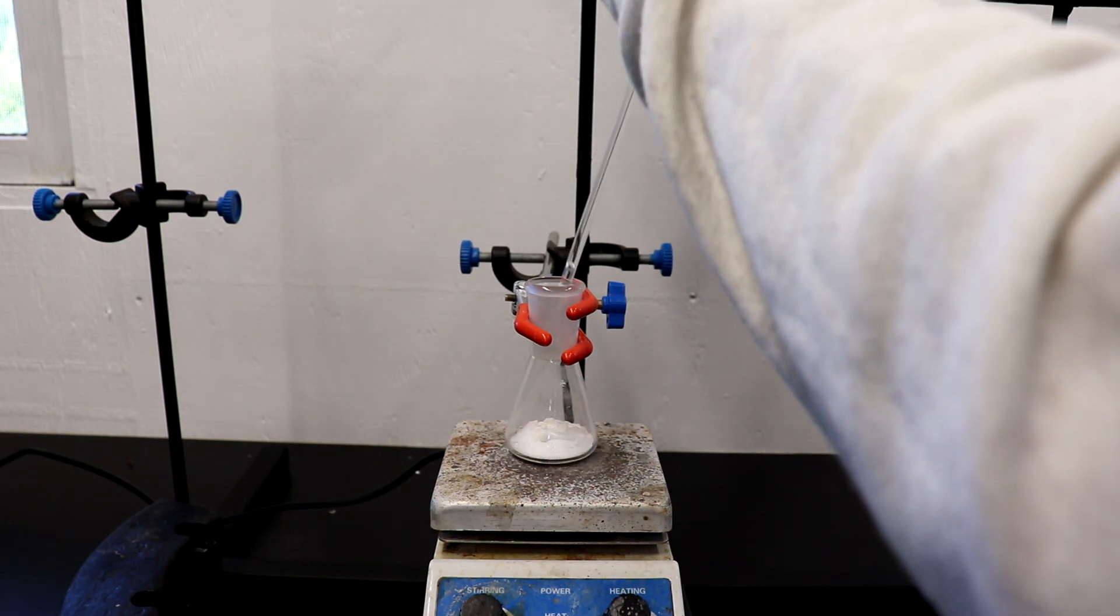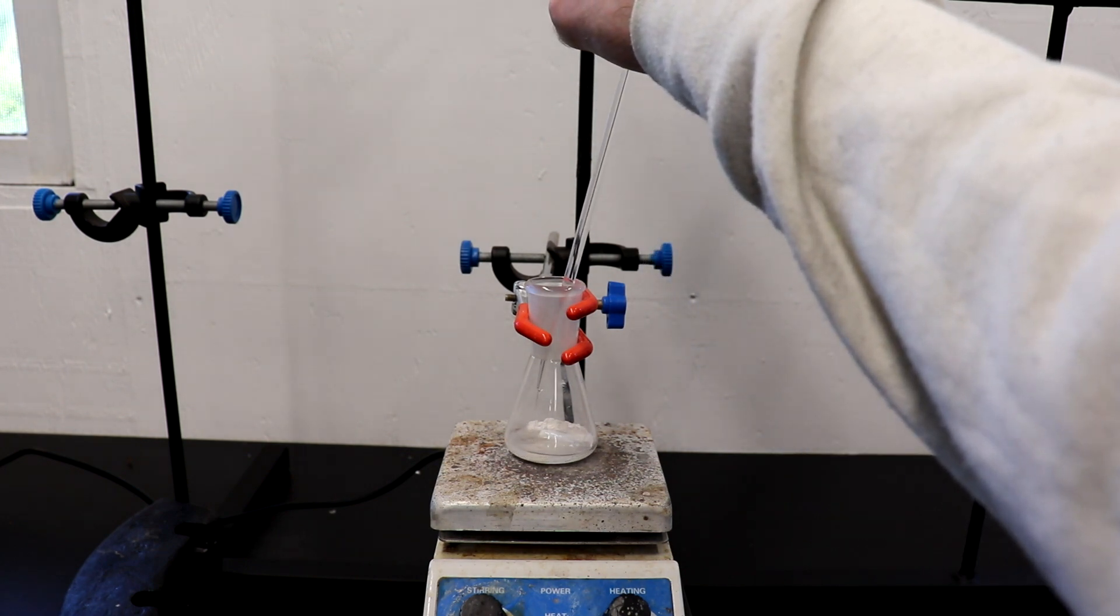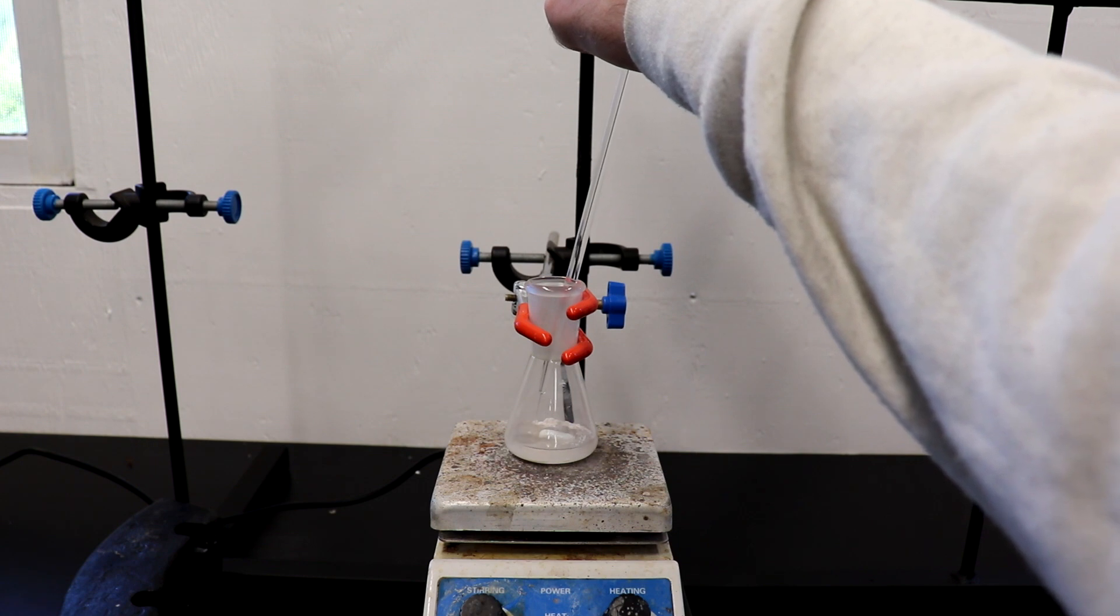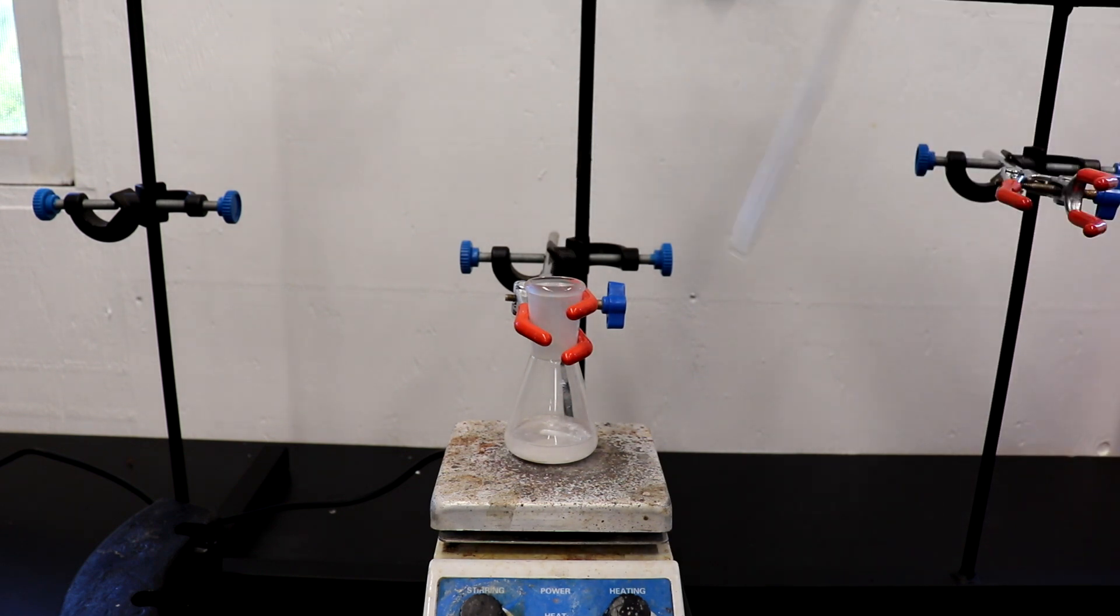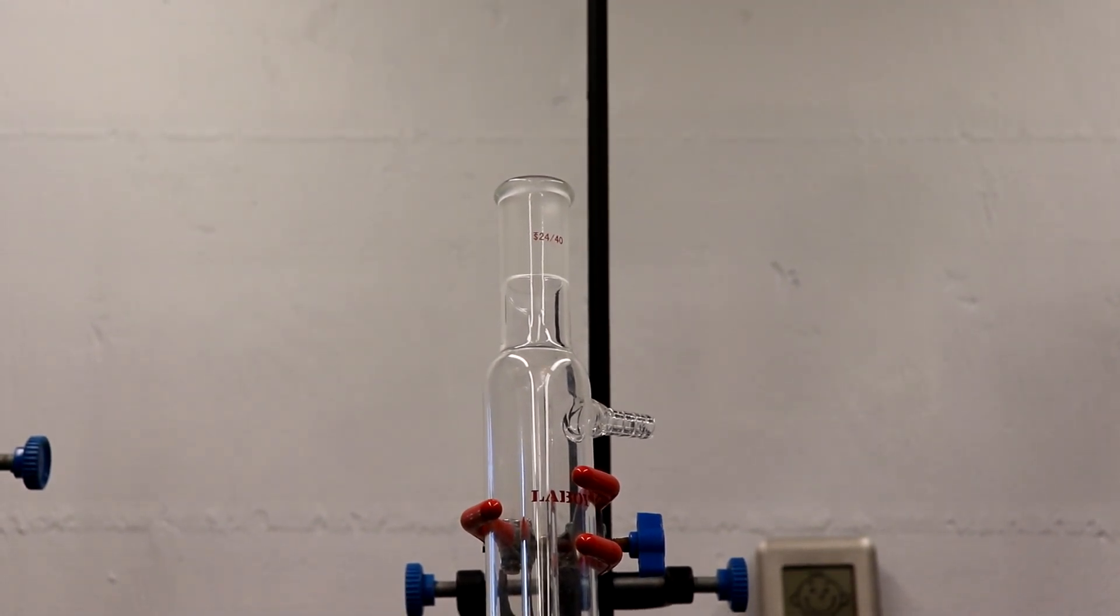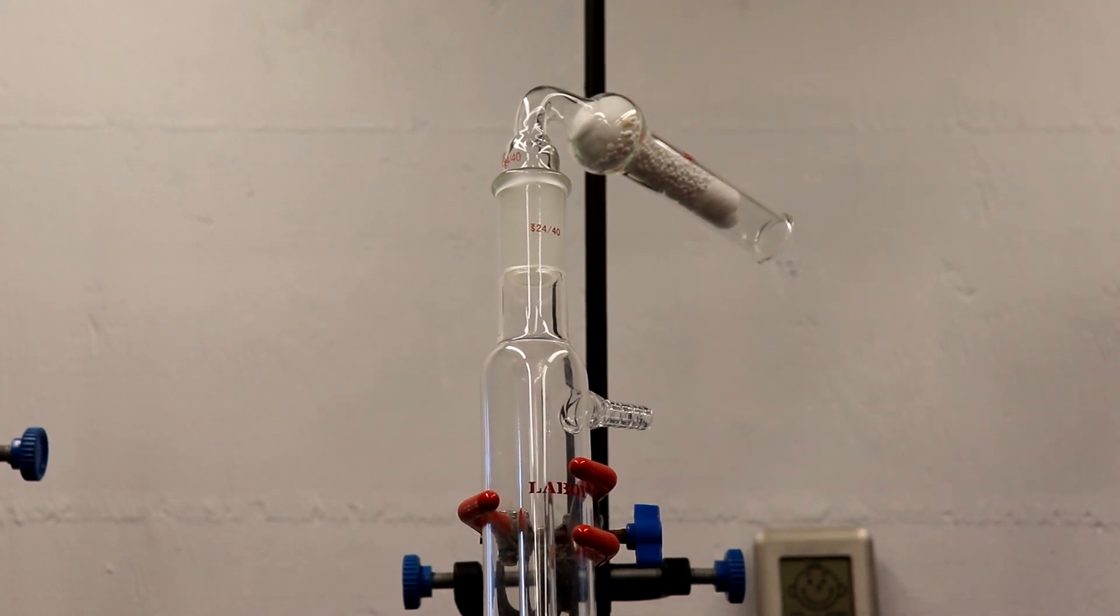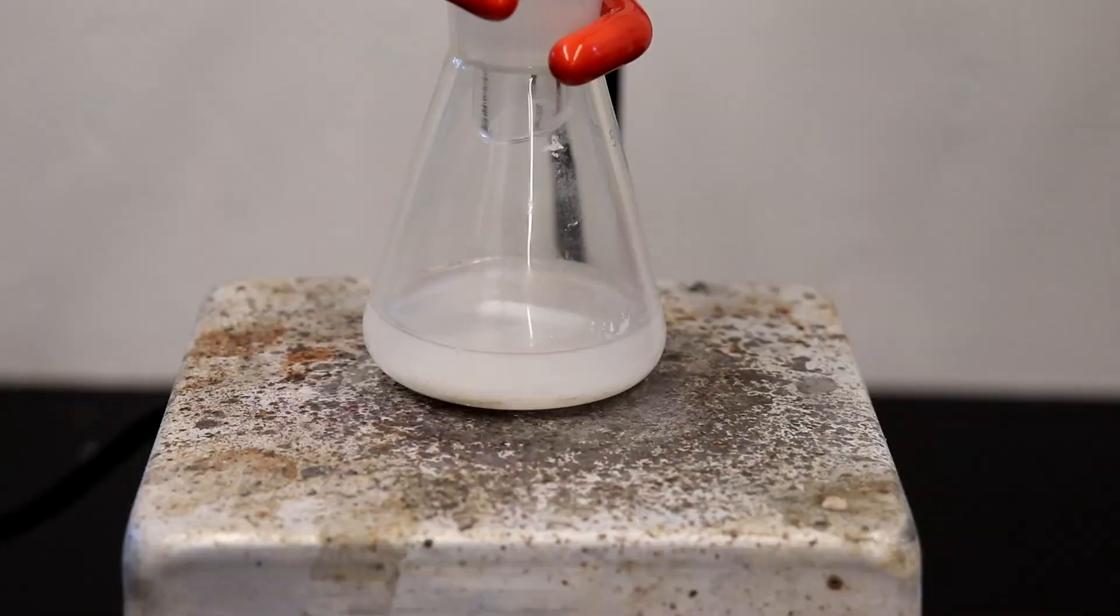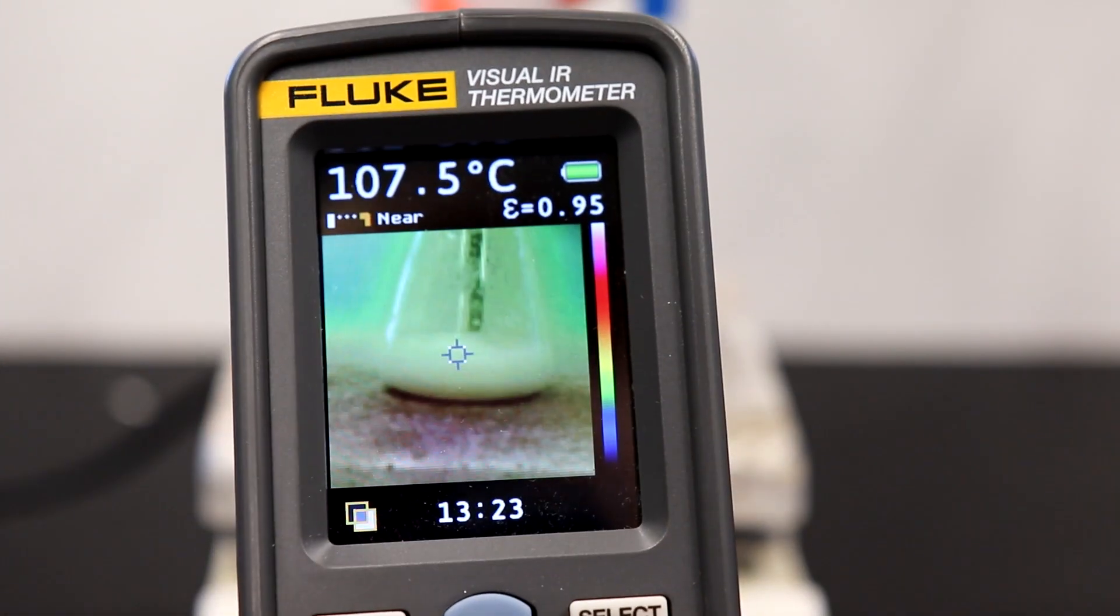The 1 gram of sodium acetate, 2 grams of sucrose, and 10 milliliters of acetic anhydride were combined in a 50 milliliter Erlenmeyer flask. The reaction was heated at reflux for one hour.